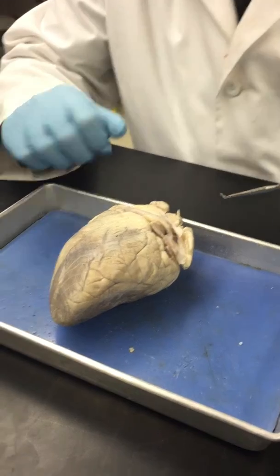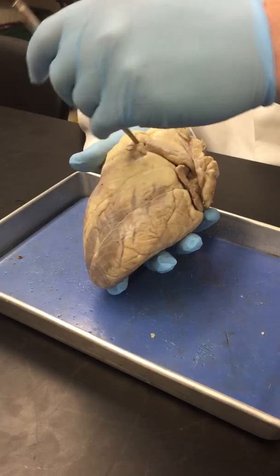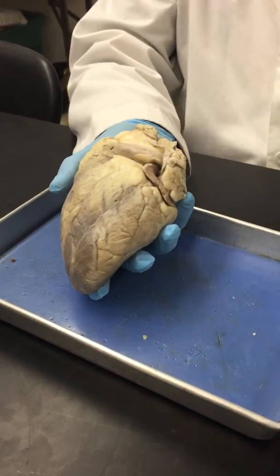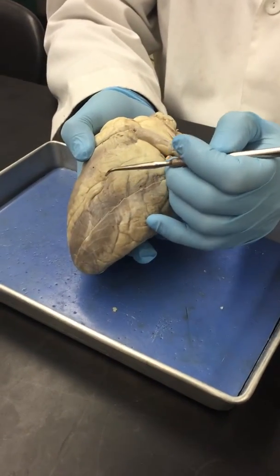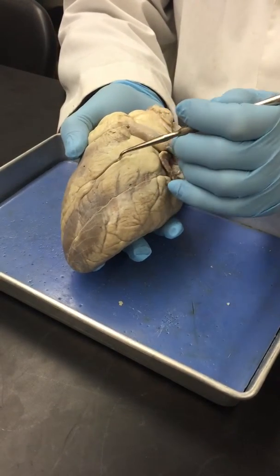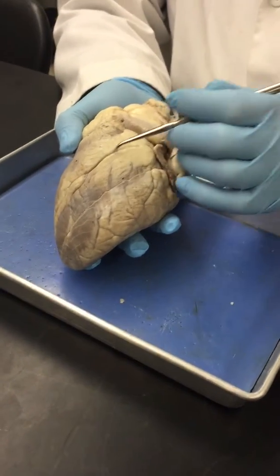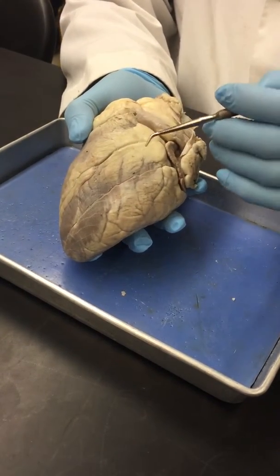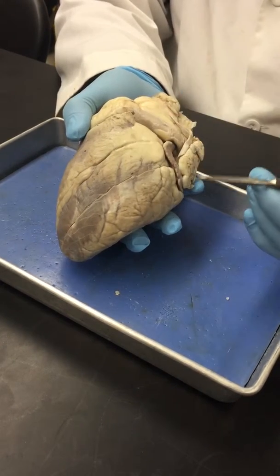The first thing is the pulmonary artery. This is the vessel that brings blood in this direction to the lungs, so it gets oxygenated. Also on the ventral surface of the heart is the anterior longitudinal sulcus. Sulcus is an anatomical term for groove. This is where the coronary blood vessels are located too. These are the blood vessels that supply the heart with its blood supply, so this is where heart attacks occur if these clot up.